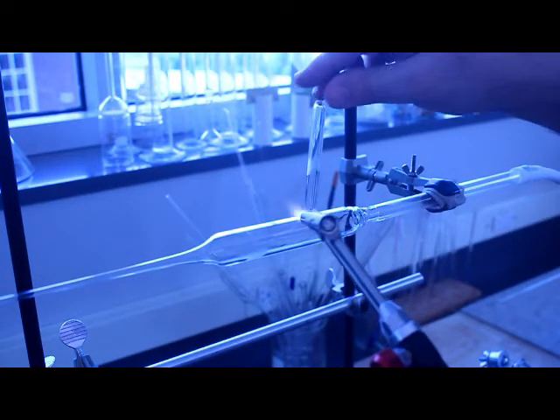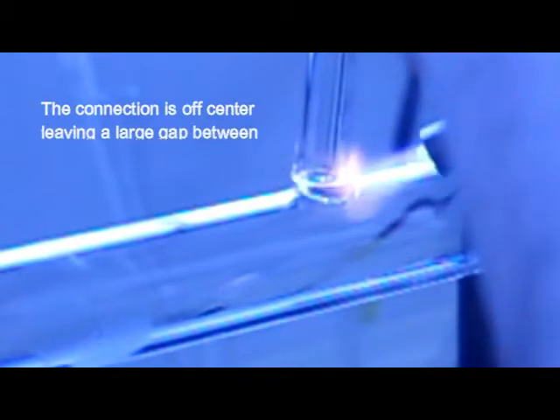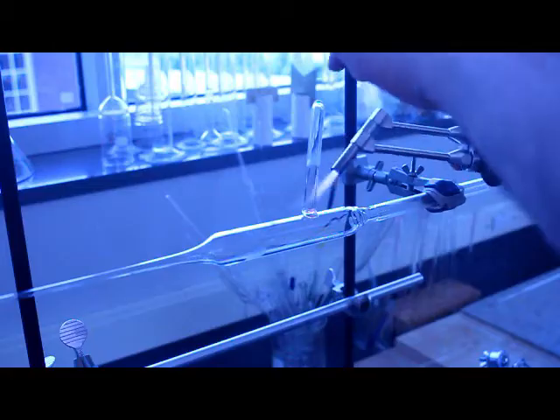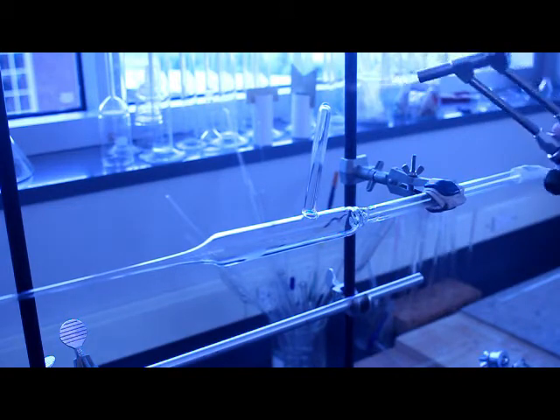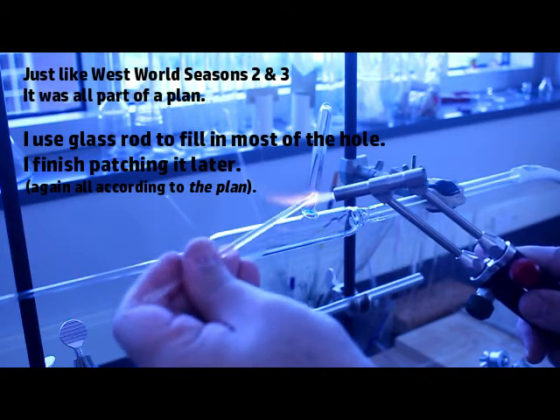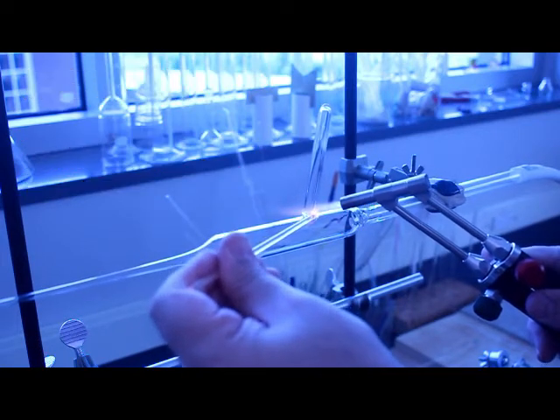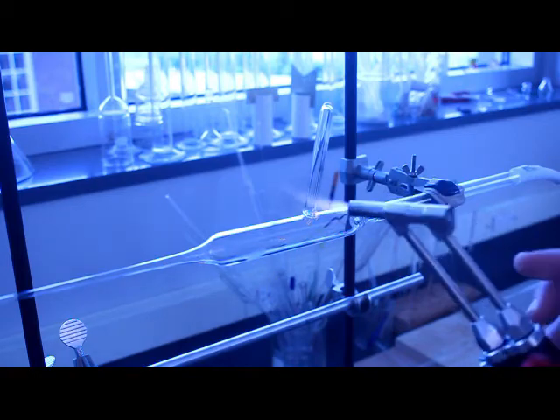As you watch this video, this is really just to demonstrate some of these glass blowing techniques and I will be making more detailed videos of this going forward. So again I'll zoom in on this in a second, you can see I've stuck the two pieces of glass together right there. But you can if you look very carefully or not even that carefully, you can see there's a very large gap between those two pieces of tubing, like we're talking well over a millimeter which is like a country mile in glass blowing, it's terrible. But you'll see I will fix it. The seal that I'm going to end up with when all is said and done is not going to be very good, but I will tell you this, this seal will be better than anything I ever did when I was a graduate student or a postdoctoral researcher, and those seals were good enough from a chemistry point of view to get my research projects moving.